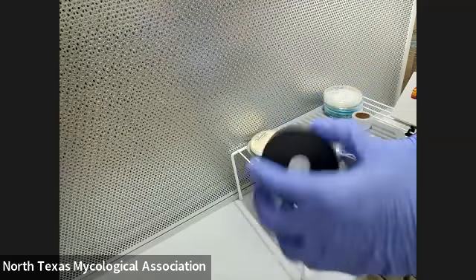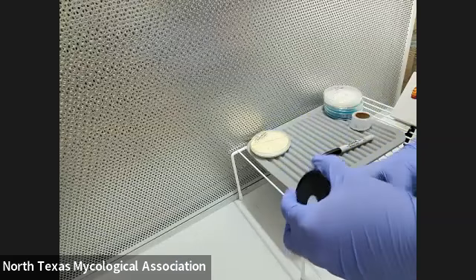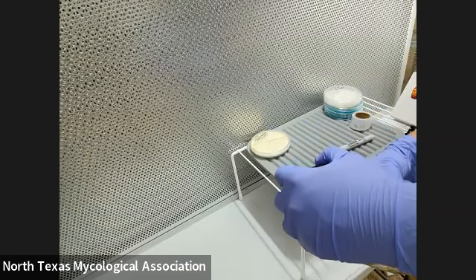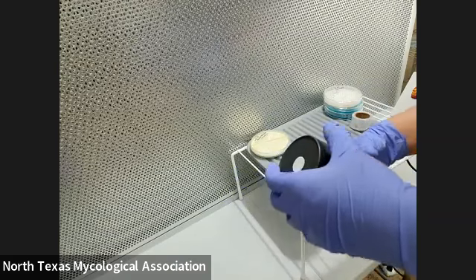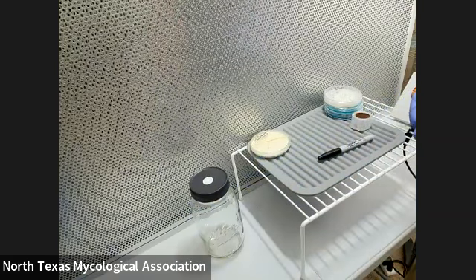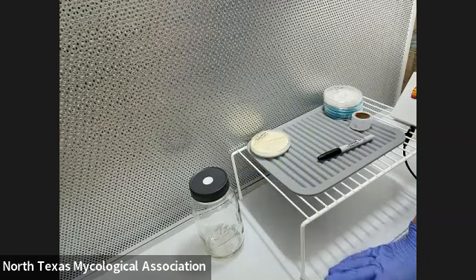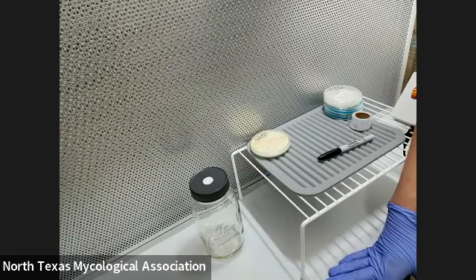How do you sterilize your grain? You use a pressure cooker — it has to be run at 15 PSI for two hours to sterilize your grain. You can also buy the grains already sterile. But I make them myself. The ones they sell in pre-made bags are really expensive — like a bag of wheat is like $13, for 40 pounds. And those bags are like what, $10?